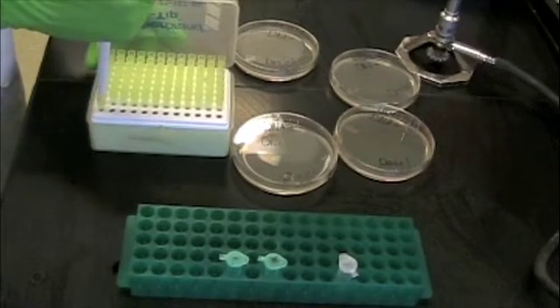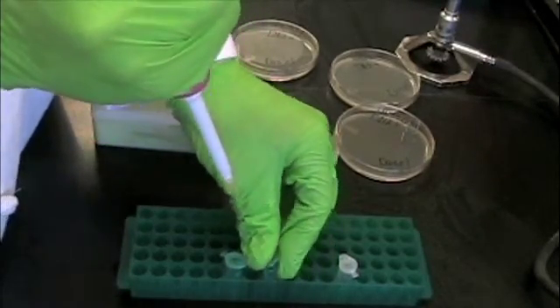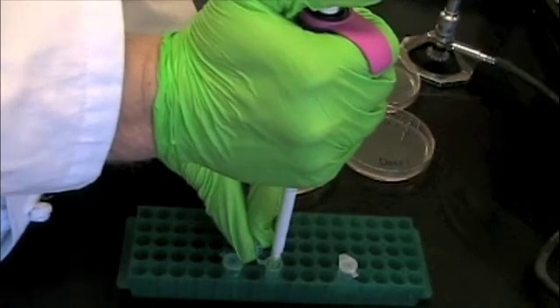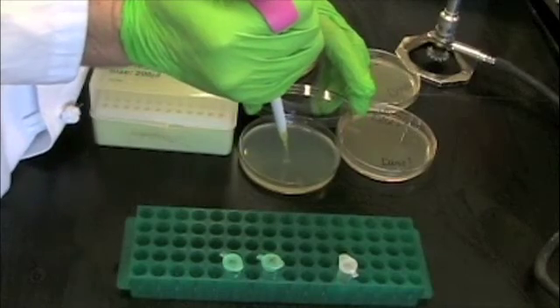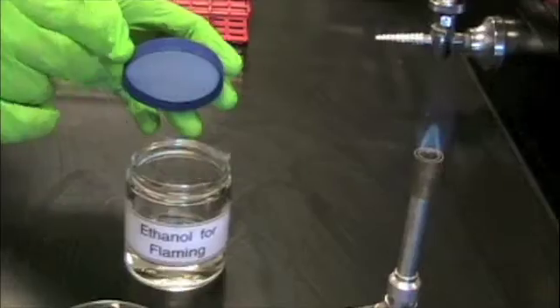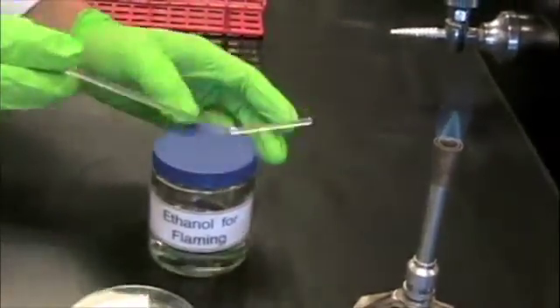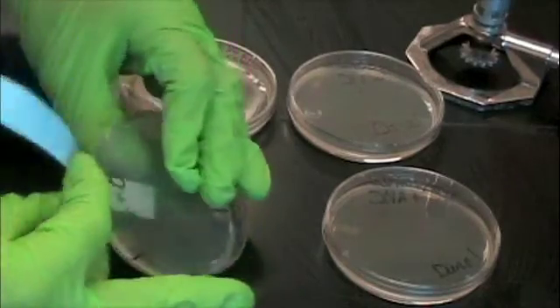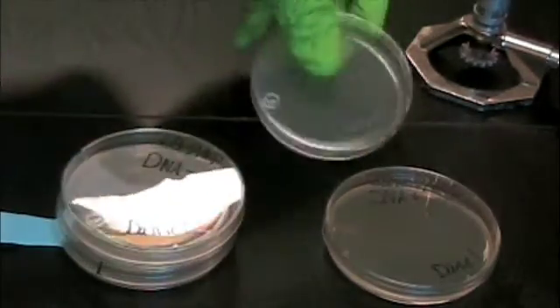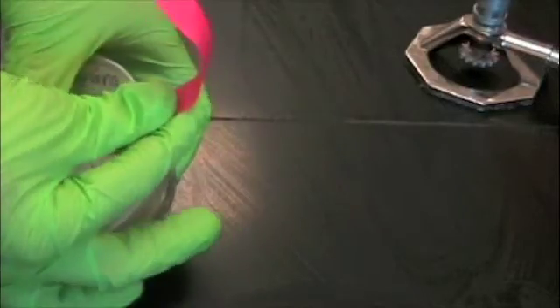The final step is to take 125 microliters of the DNA plus or DNA negative solution and spread it onto each of the agar plates previously marked DNA plus or negative. Each plate will be spread with glass hockey sticks, stacked upside down, taped, and placed in an incubator for 48 hours at 35 degrees Celsius. It's always nice to use your school colors for good luck — Rock Chalk Jayhawk, Go KU!